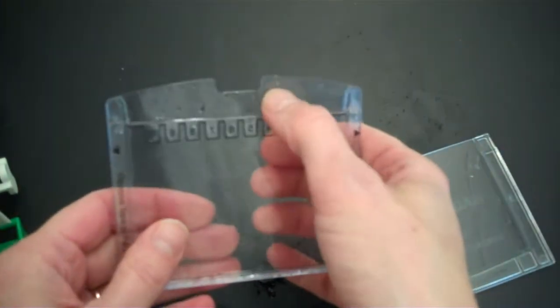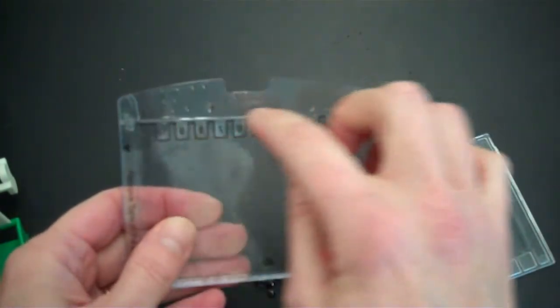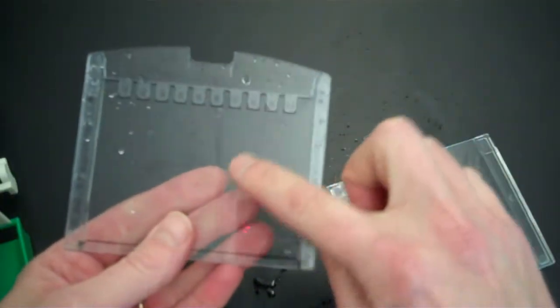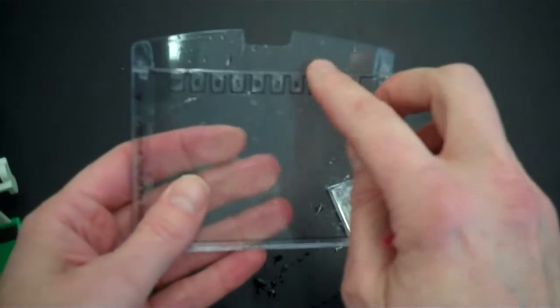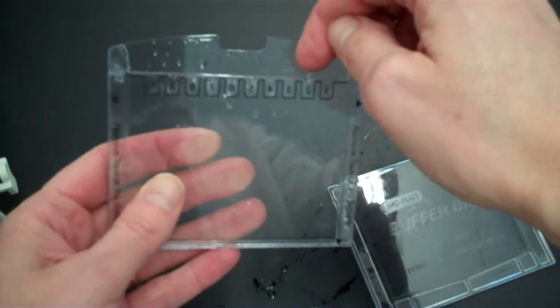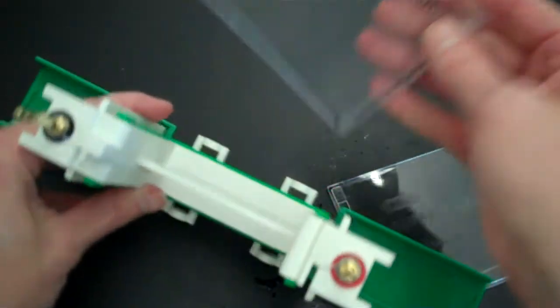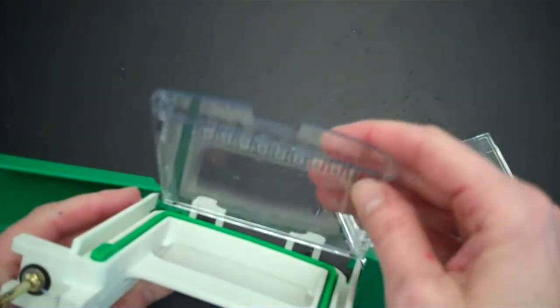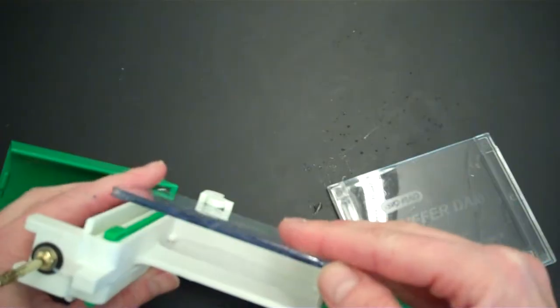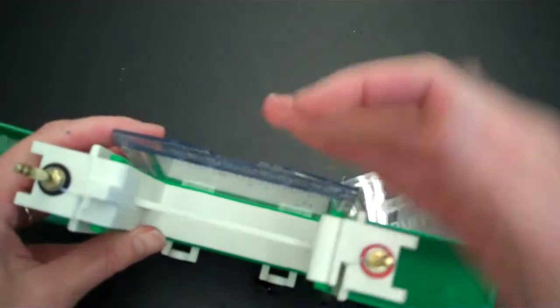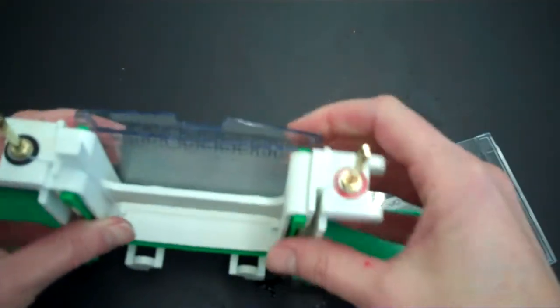What I want you to do is see on the gel that there's one side that has a short plate and the other side has a long plate. The short plate is where you're going to be putting your samples. So when you set up the electrophoresis chamber, you take this gel and you put it into the chamber such that the short plate faces the interior.